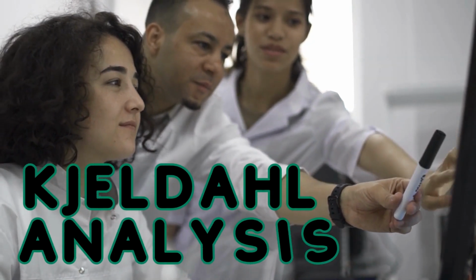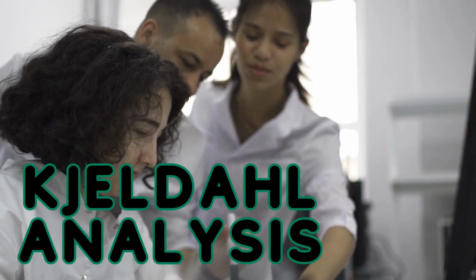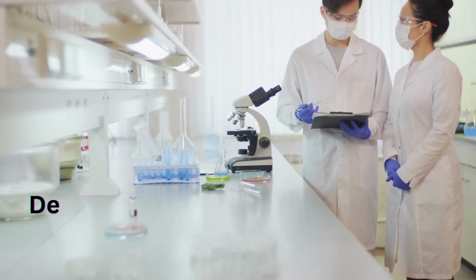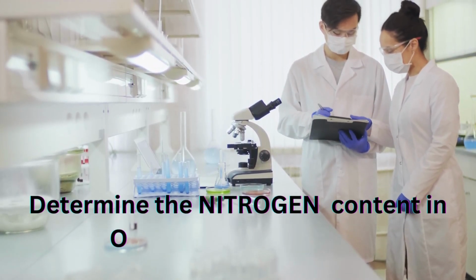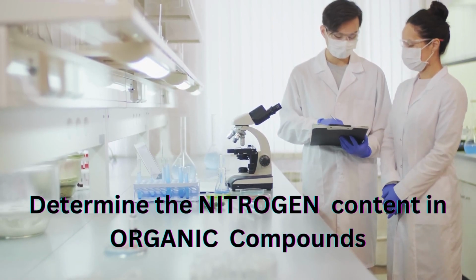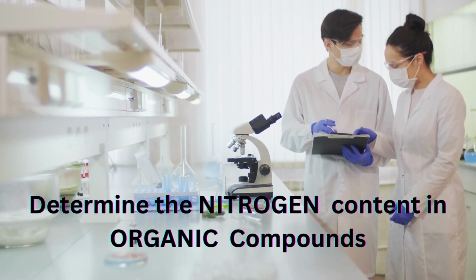Today, we have an exciting topic to discuss: Kjeldahl Analysis. In this video, we will provide a comprehensive step-by-step tutorial on performing Kjeldahl Analysis, a widely used method for determining nitrogen content in organic compounds. So, let's dive right in.